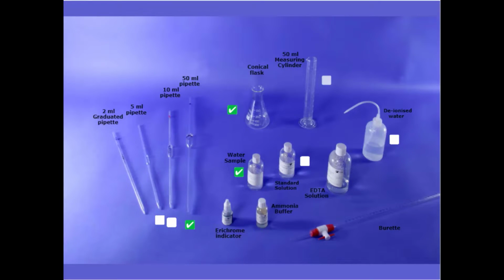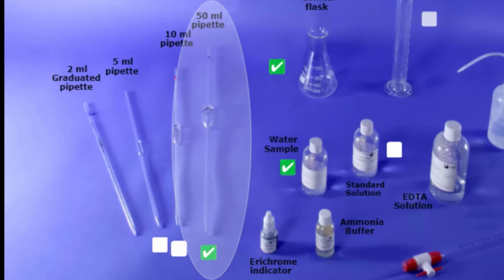Once you have selected your river water sample, you will use the same titration procedure, but with one important difference. You will use a larger volume for the river water sample, 50 milliliters, instead of the smaller 10 milliliters of standard solution used for the standardization process.